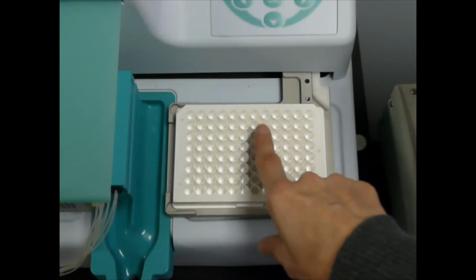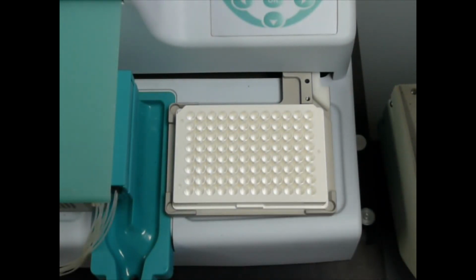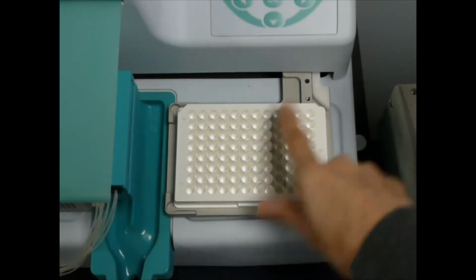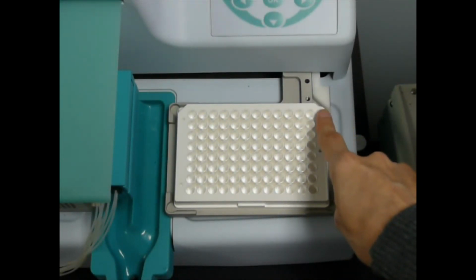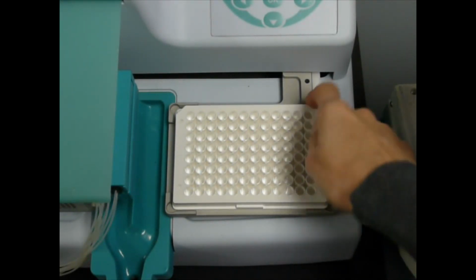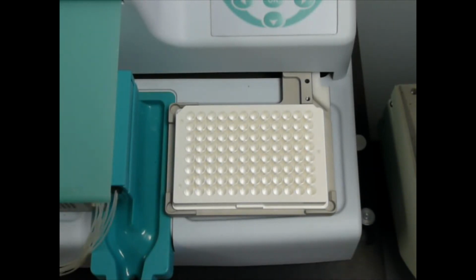What'll happen is if it's in this location, when it picks up the plate on the return, it's going to pick it up in the same location that it dropped off. If I taught it close to the arm, the arm is going to move the plate a little bit, and when I pick it up, it's going to miss the cam on the return. So a little tip: always teach opposite the arm on the instrument nest.